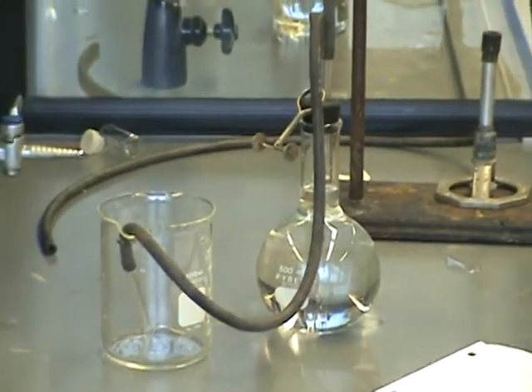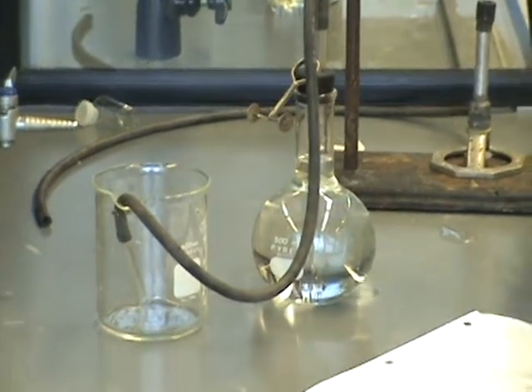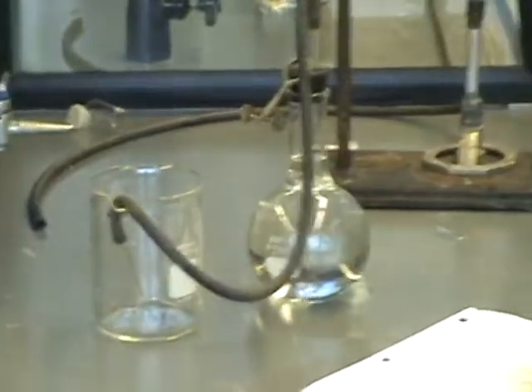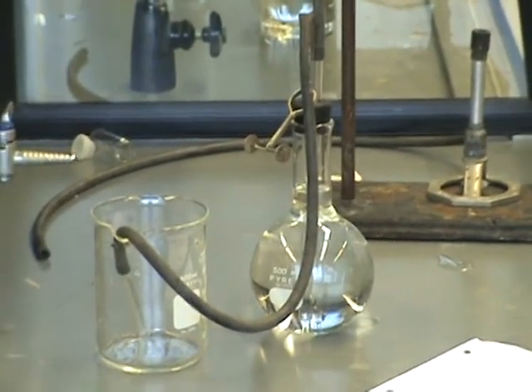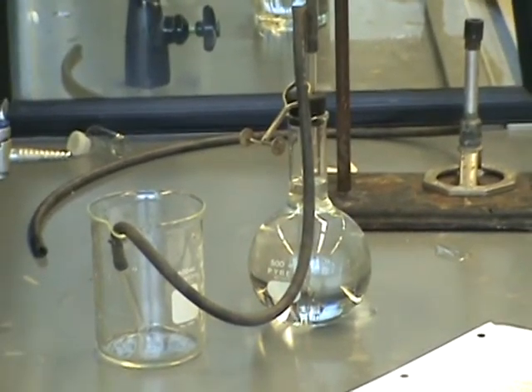So it says, if this doesn't work, start over from the very beginning. You have to follow each step in order carefully that it should work. Now at this point it says get your apparatus checked by a proctor or the instructor. Go ahead and have them checked and make sure it's set up right. And then you can go ahead and start the rest of the experiment.